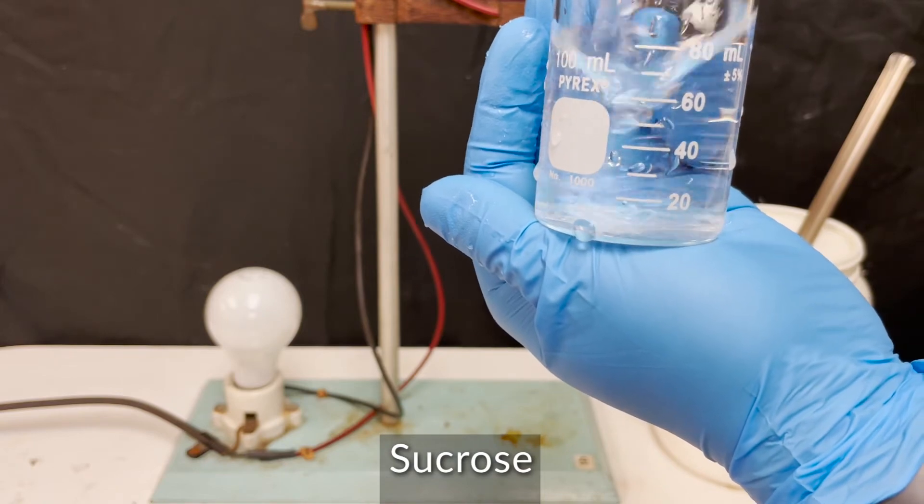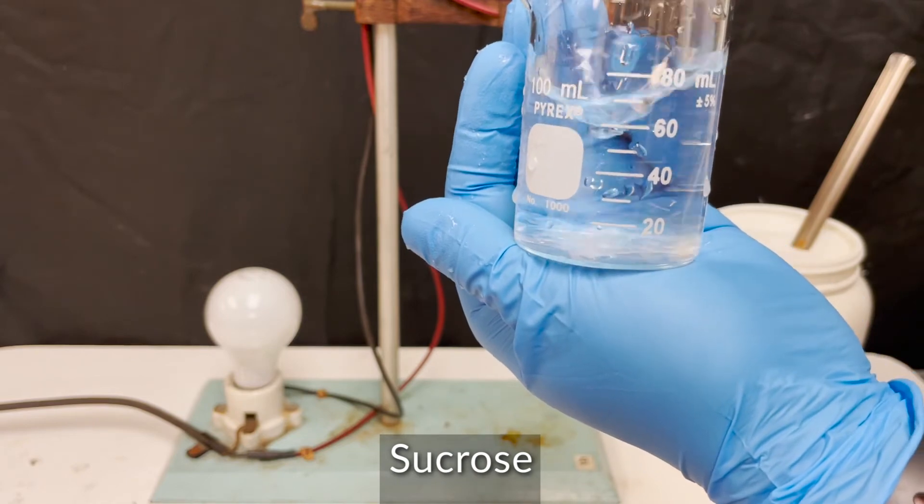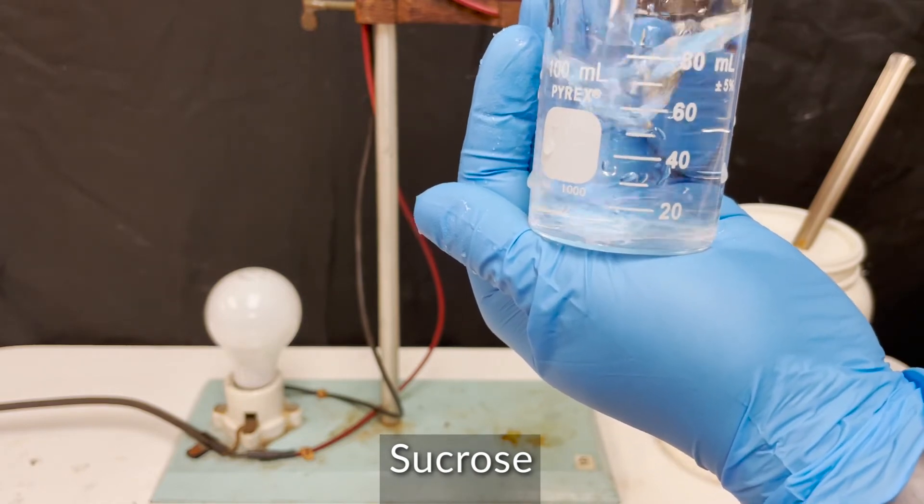Sucrose is soluble in water, but it takes a lot more effort to get it to dissolve. At the end, we still see a little bit of the undissolved compound sitting at the bottom.